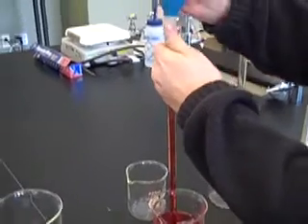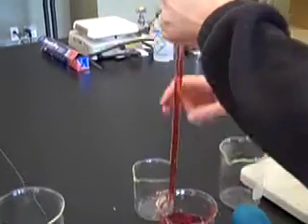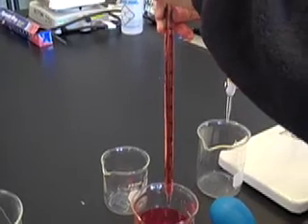Then, replace the bulb with your finger and slowly let the fluid out until you have the desired volume in the pipette.